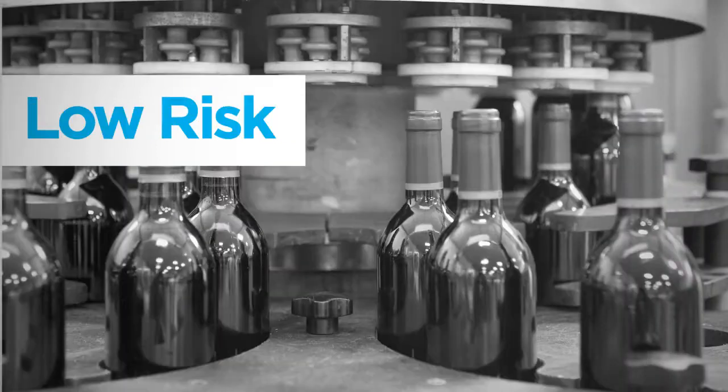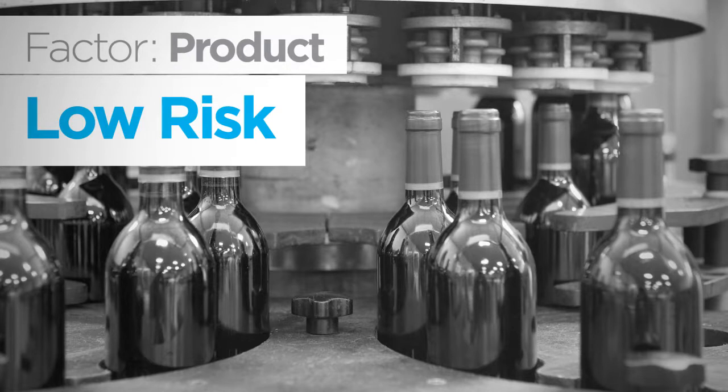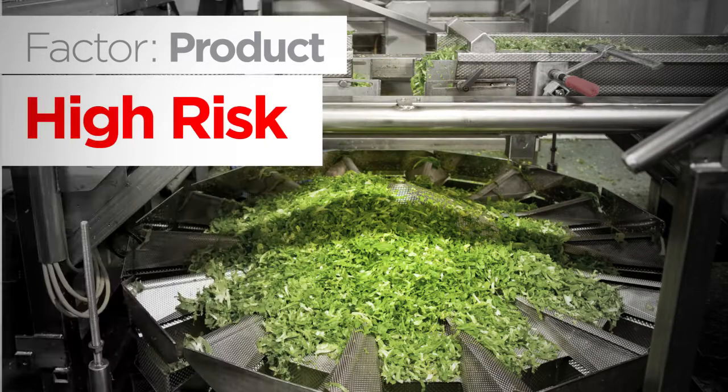The last factor is the type of product. Products with a lower risk of contamination, such as cooked products or products with a longer shelf life, can have higher RLU limits. On the other hand, products with a higher risk of contamination, such as ready-to-eat products and products with a short shelf life, may require lower RLU limits.